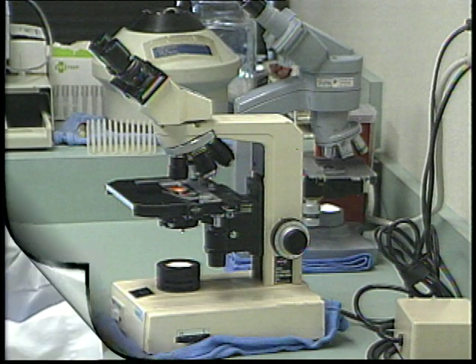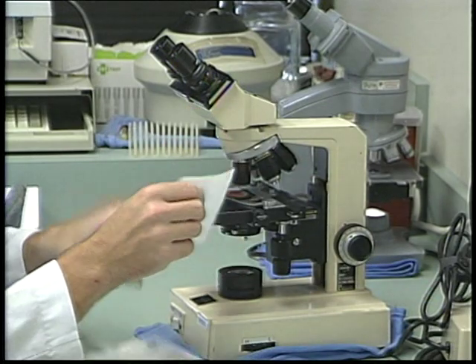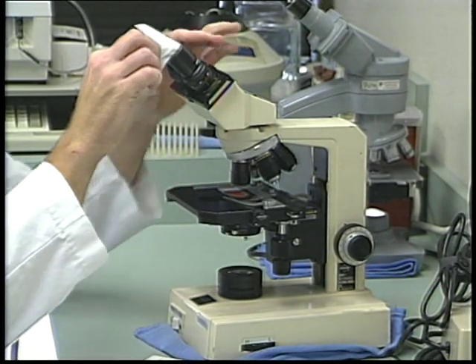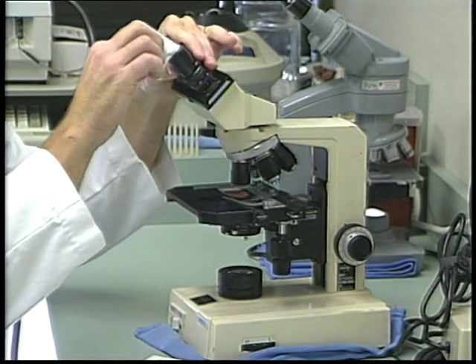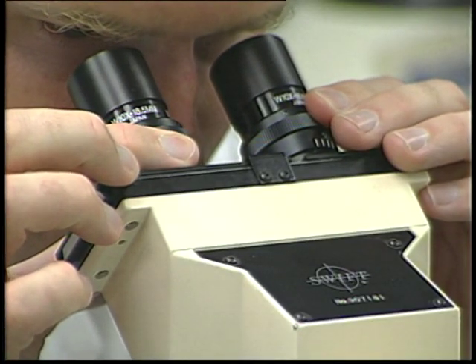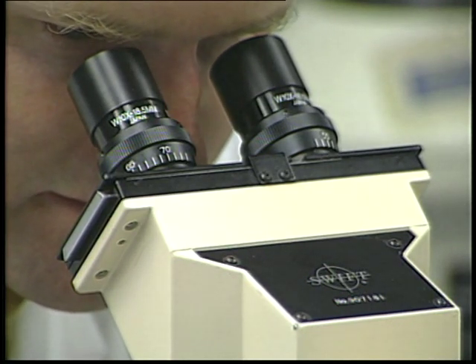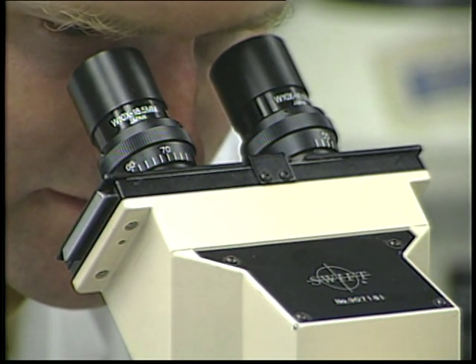When working with a microscope, be careful not to touch the lenses and only clean them with special lens paper, not ordinary tissue products, as these may scratch. You will probably need to first adjust the eyepieces on a binocular microscope to a distance that allows you to comfortably look with both eyes. When peering through the microscope, it is helpful to relax your eyes and focus them as if you were looking at something on the counter below.